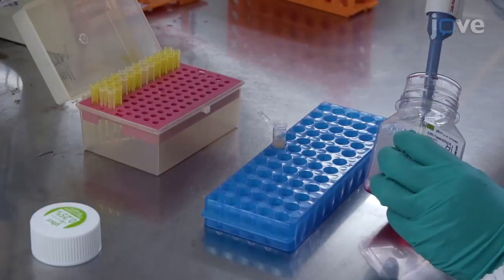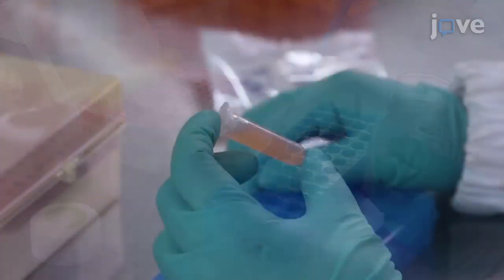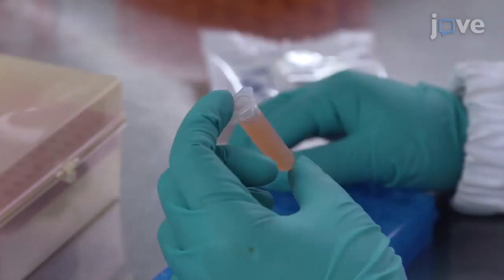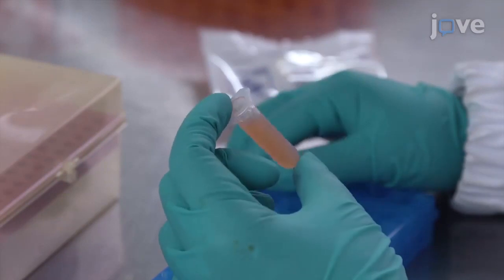Add 400 µL of 0.25% trypsin, mix the solution by inversion, and incubate it for 5 minutes at room temperature.